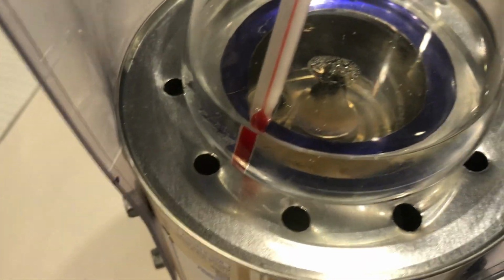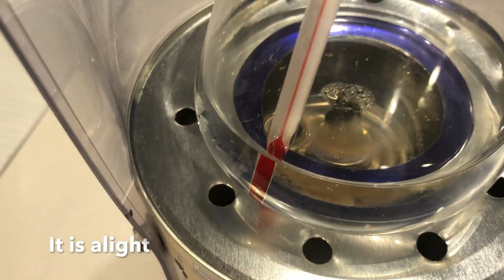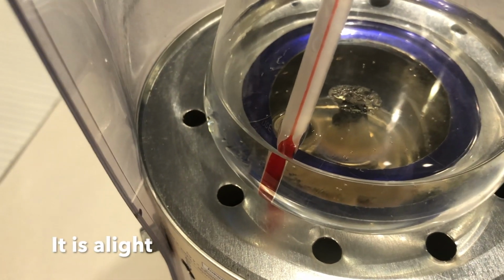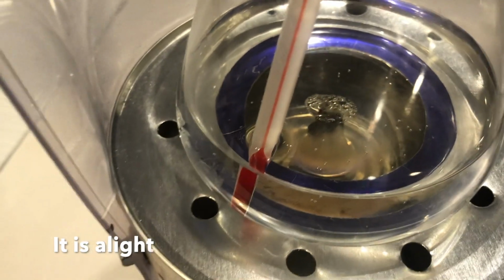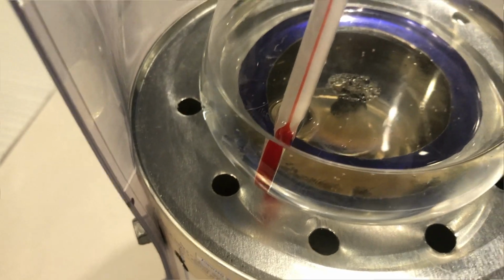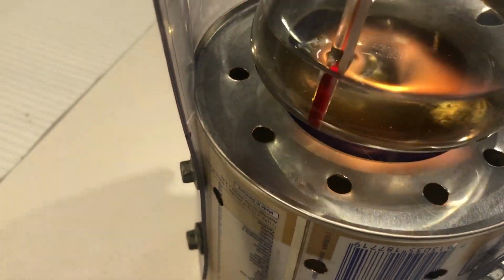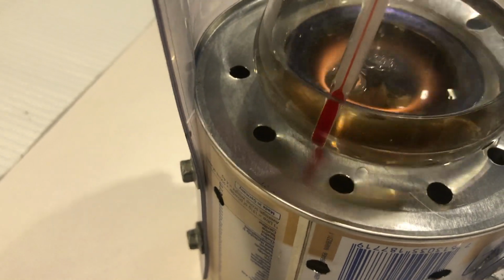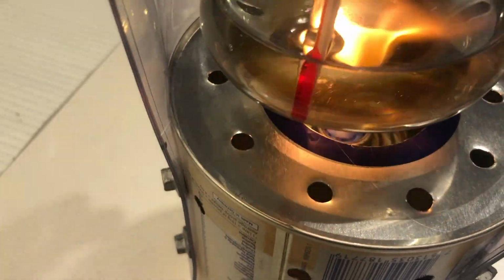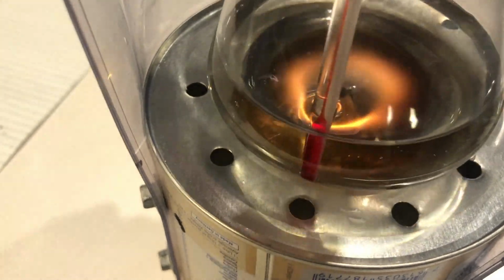In order to minimize the effect of heat loss to the environment, or heat loss by accidentally boiling some water that was stuck to the bottom of the flask, these sources of error, we can minimize them by repeating and trialing this experiment over and over again, averaging our delta HC value each time, ignoring any of the outliers. Now in these sort of experiments, it is important to note that the color of the flame tells you how cleanly the fuel is burning. And if the flame was super yellow, then that's a signal of incomplete combustion, and that's also going to give us a source of error.